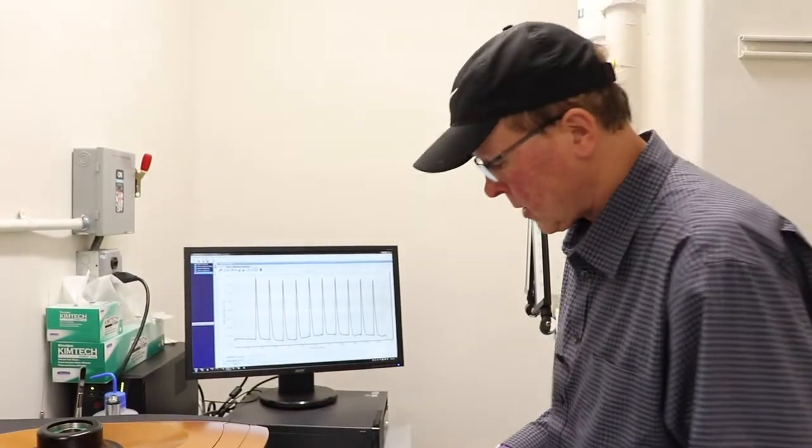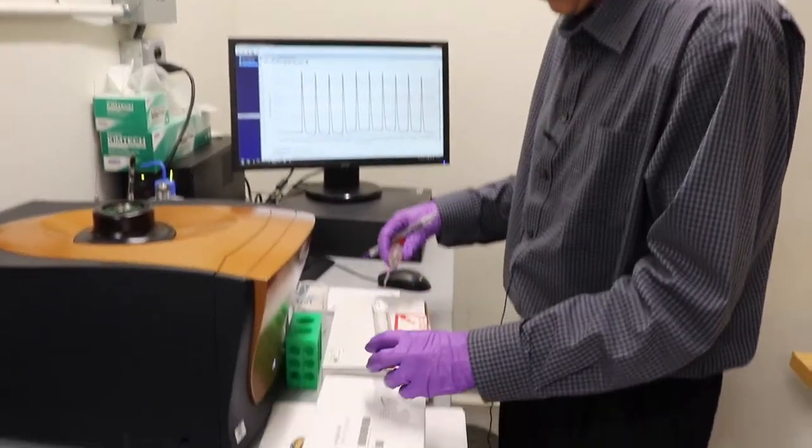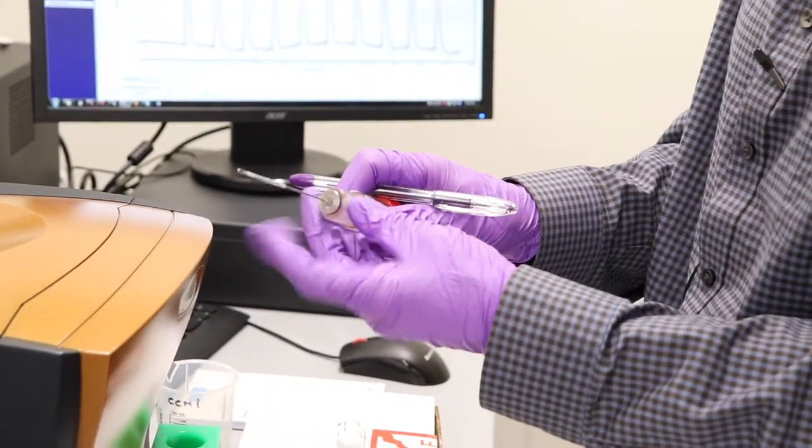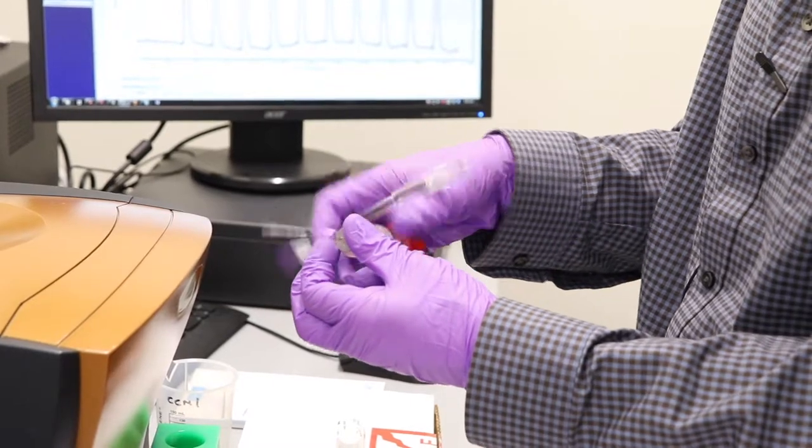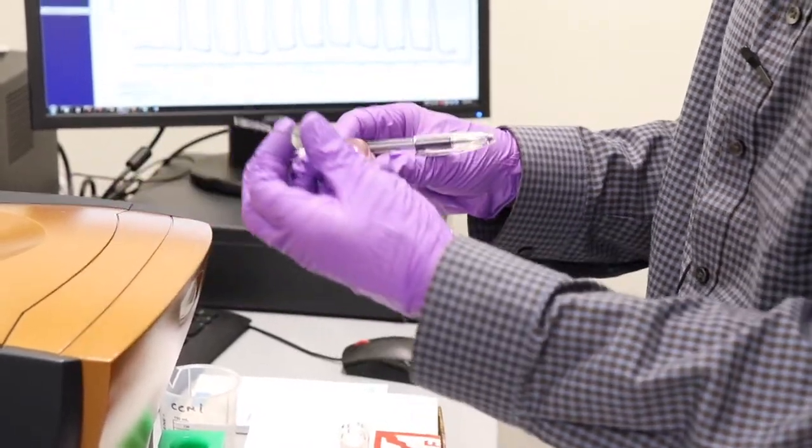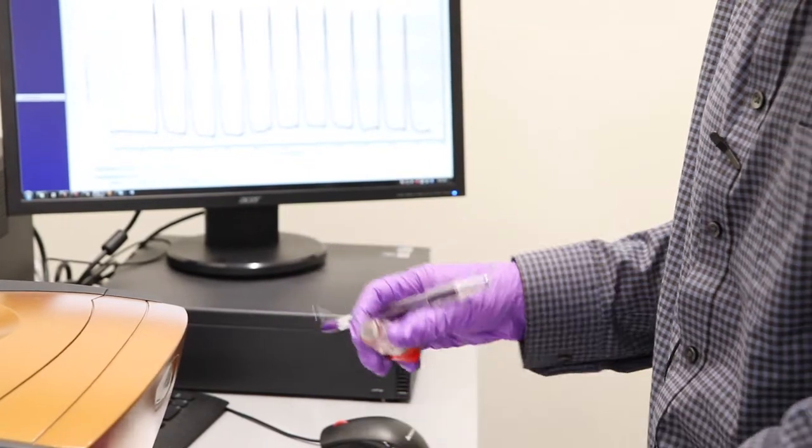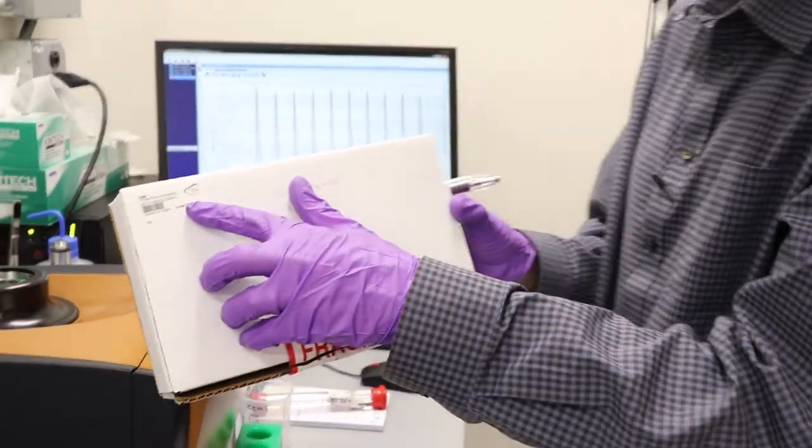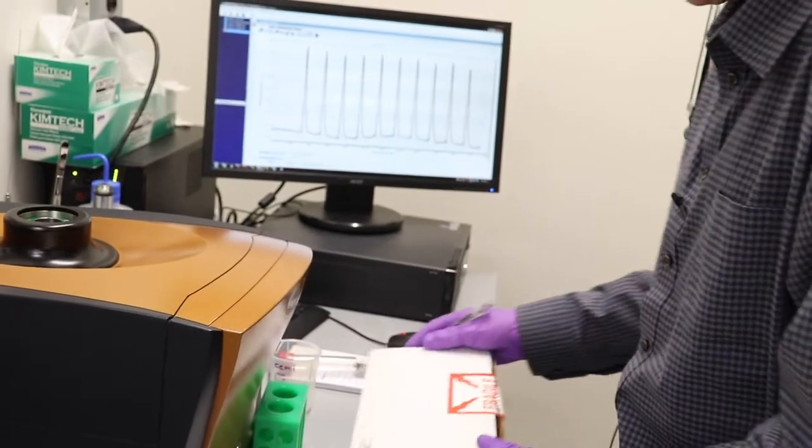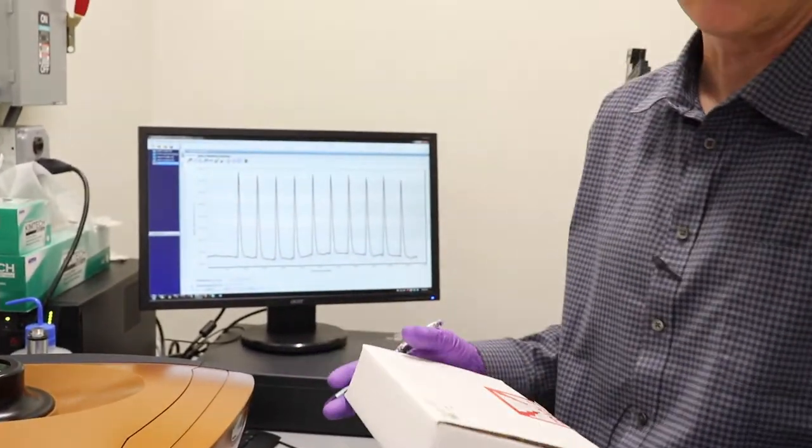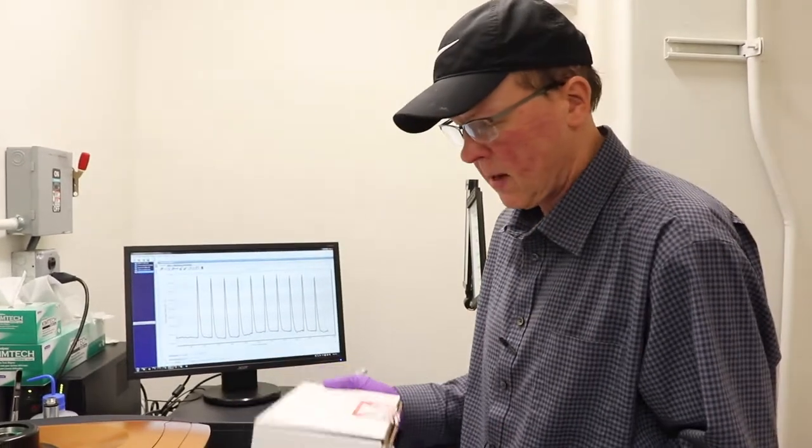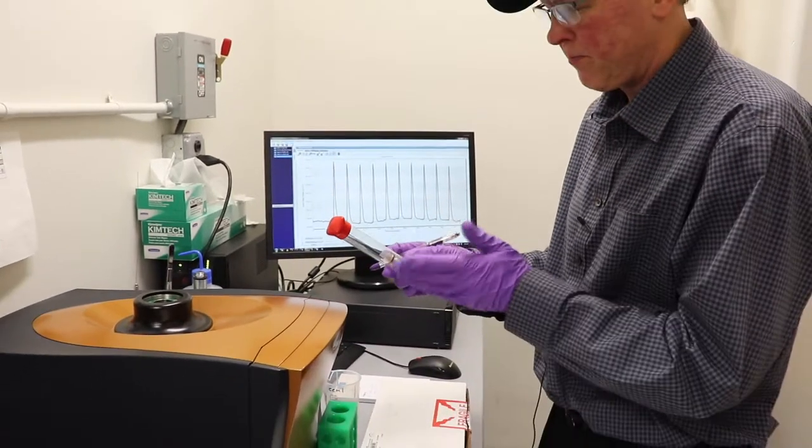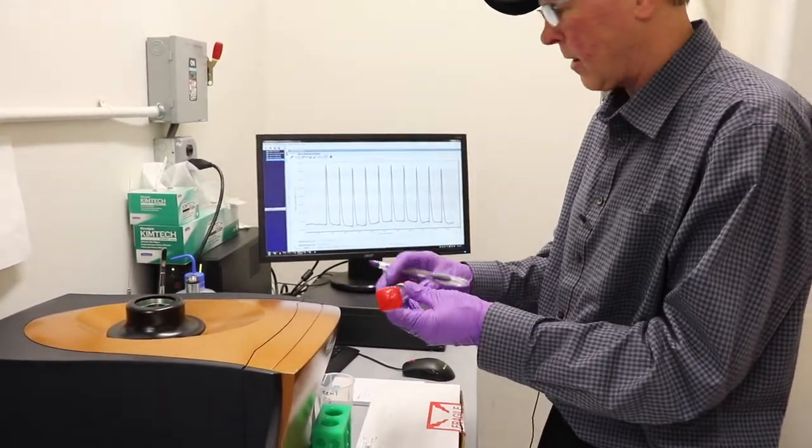The stuff you'll need to bring, the first thing you need is a syringe which is going to inject your titrant into your sample. One of these here. So you're required to bring your own and buy one. That's the part number from TA Instruments there. I usually have a new one in stock so if you order it and show me your PO you can have this one and then just give me the new one when it comes in. I also have a couple of practice ones that are bent. You can use them but I can't promise great data off of them.